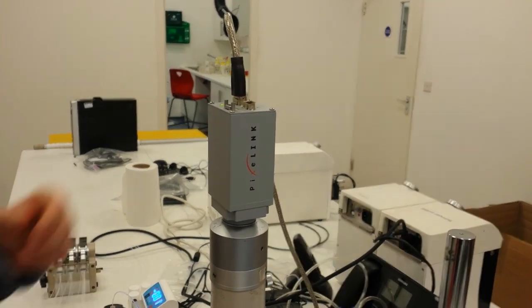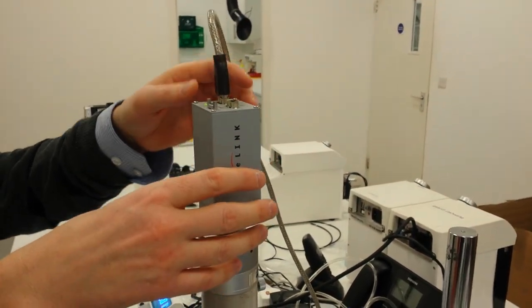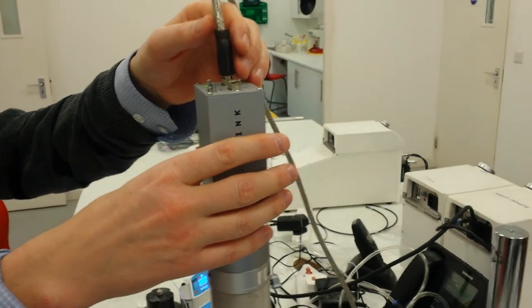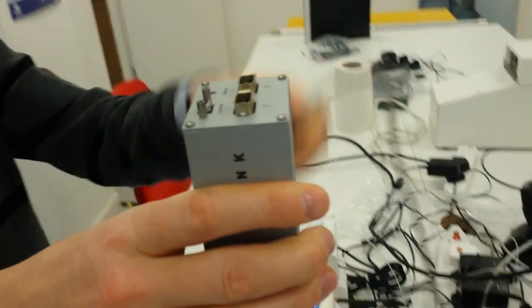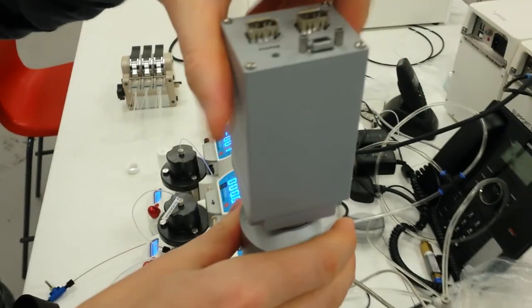Just a quick video to show how to mount the high-speed camera from Dolomite to a microscope. I'm going to take the firewire out for a second.